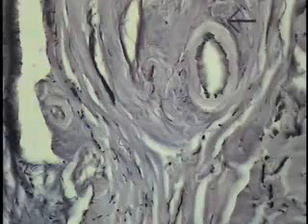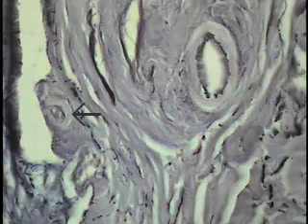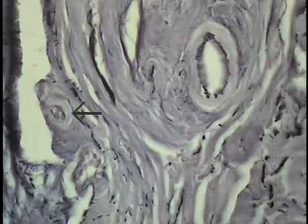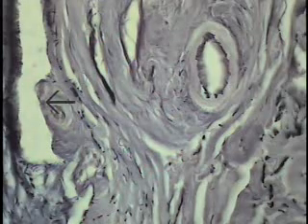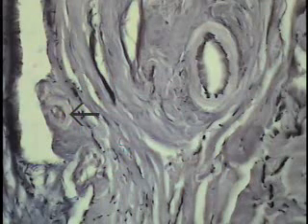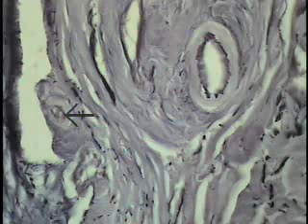The same vessel as shown here, but the field has been moved over, and there happens to be a smaller vessel, an arteriole, located at this particular position. Notice that the media has 2 smooth muscle cell wraps. It looks fairly robust because even in these small arterioles, the media forms the major component of the wall, and it makes it look perhaps more robust than it really is. But note the persistence, again, with this elastin stain of the internal elastic laminae.